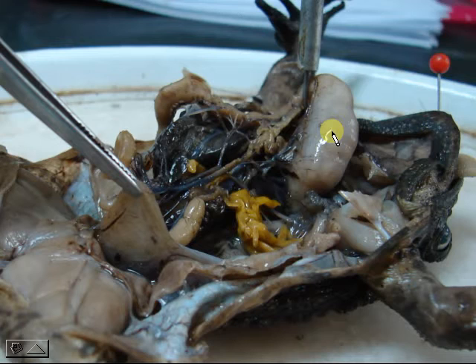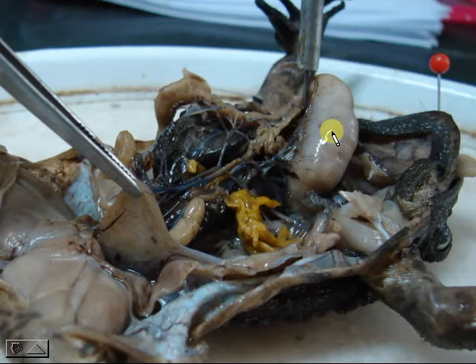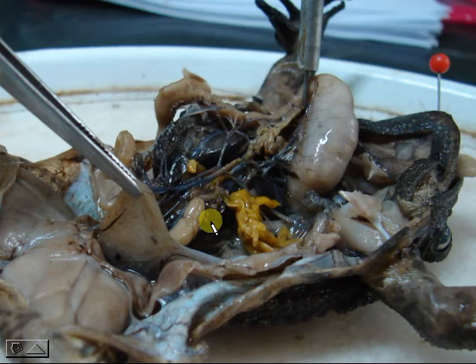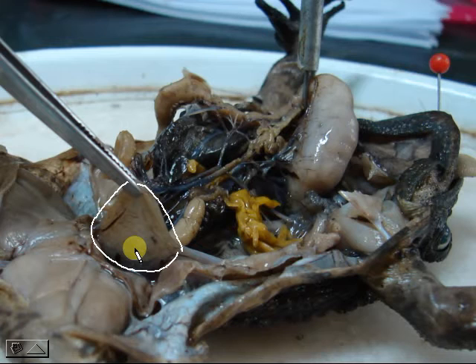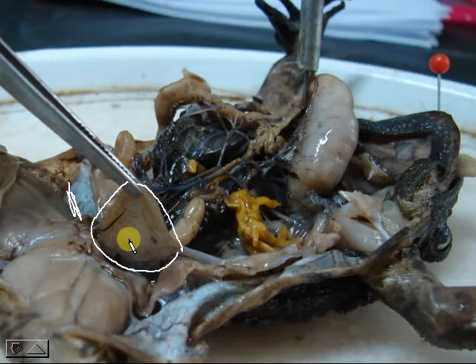Now let's move on to the urogenital system. For the urogenital system, the blood is regularly filtered by your kidneys, and the waste materials are passed out in urine. The part lifted by your forceps here is called the urinary bladder — that is where urine is stored. There is also one on the other side.